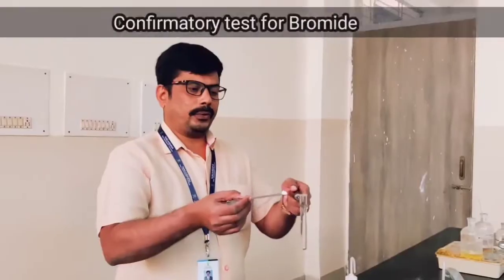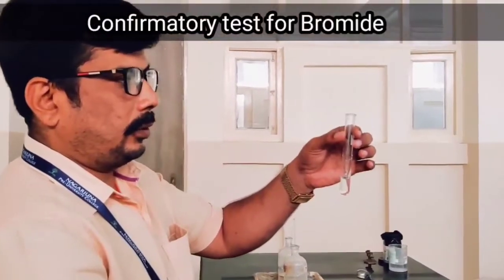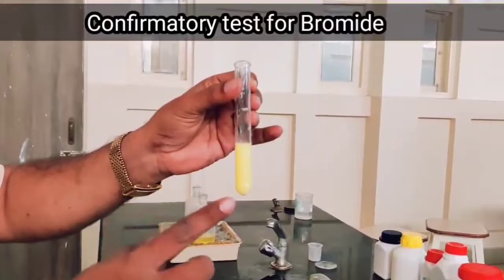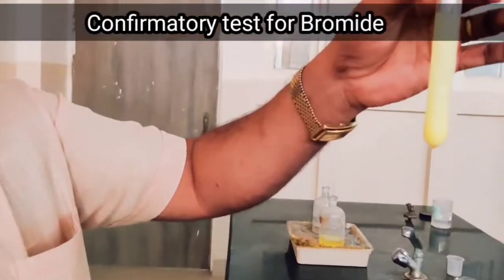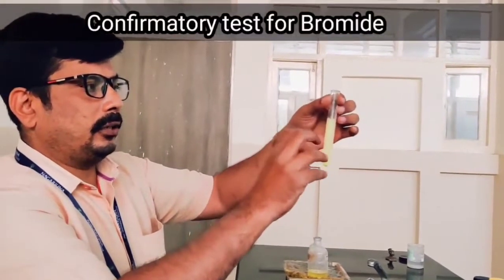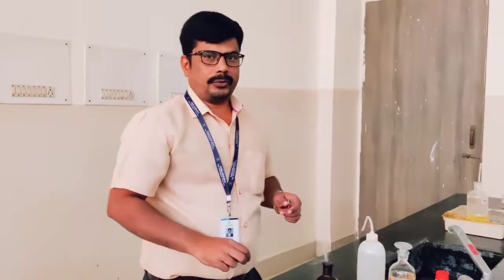We get Br⁻. Now do the confirmation test for bromide. Take the salt solution in a test tube and add a few drops of silver nitrate solution — this indicates that bromide is confirmed. Now add ammonium hydroxide in excess. If it is partially soluble and not completely soluble, that indicates the given salt contains bromide ion. So the acid radical is bromide, Br⁻, and this is the confirmation of the acid radical.